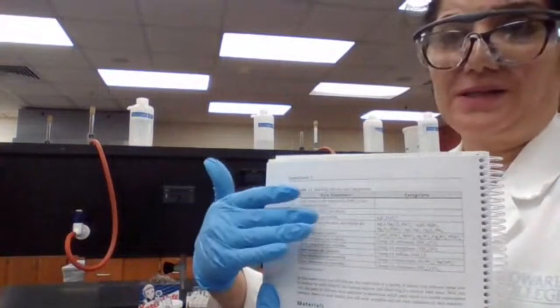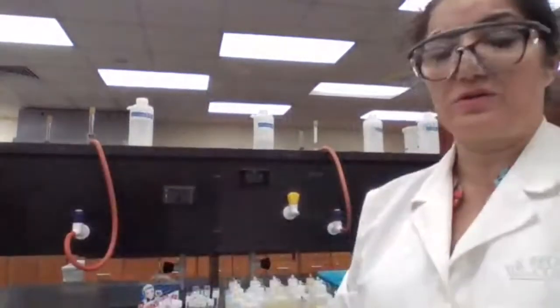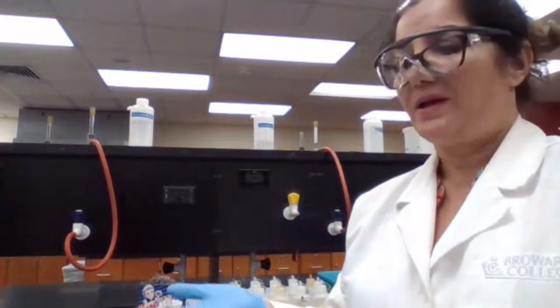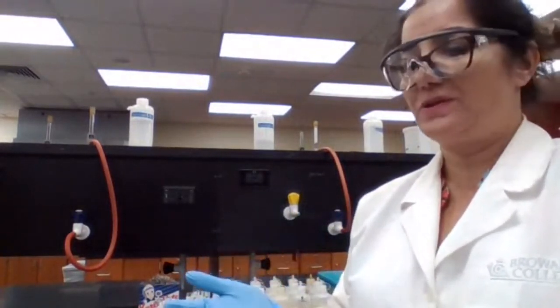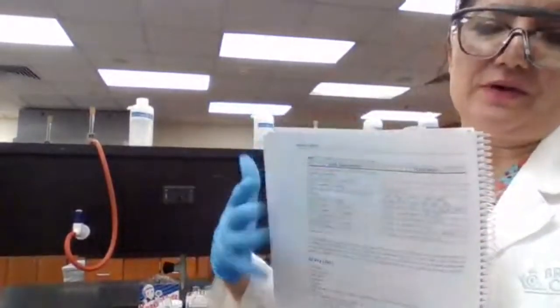If your compound contains group 1A, it would always be soluble. It doesn't matter if it's sodium chloride, sodium bromide, sodium acetate, or sodium sulfate. Whatever has sodium is going to be soluble. If it has nitrate, it's going to be soluble. If it has acetate or the ammonium ion, it's going to be soluble, with no exceptions. For everything else, there are some exceptions, so you have to look at the chart and identify your precipitate.